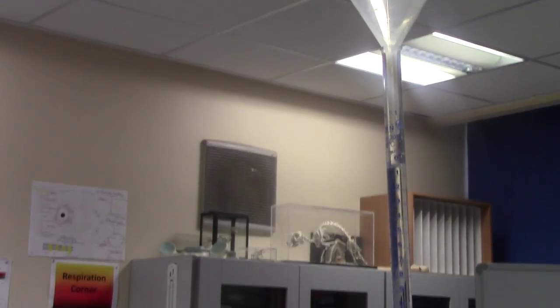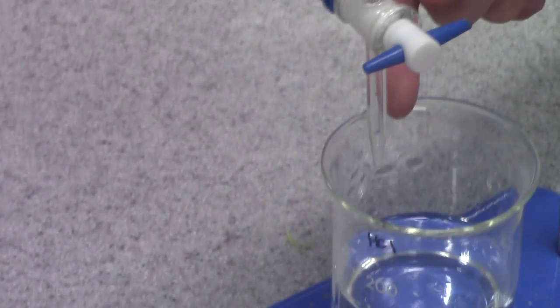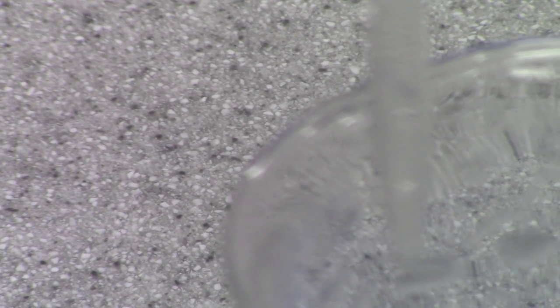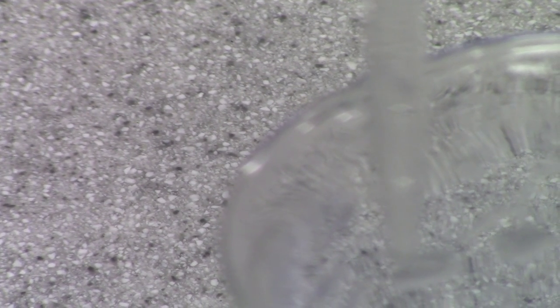Before I start using it, the whole point is to get a precise volume, so I need to make sure there's no air bubbles trapped in there. Particularly down here underneath the tap, there is an air bubble trapped here, so I need to open the tap and release some titrant, making sure there's no air bubbles in there.